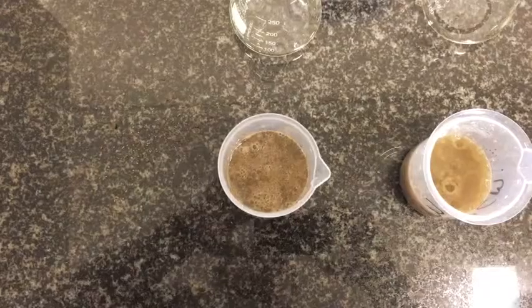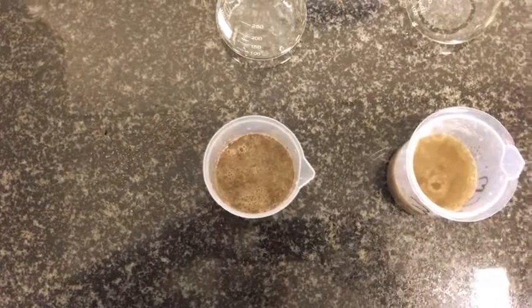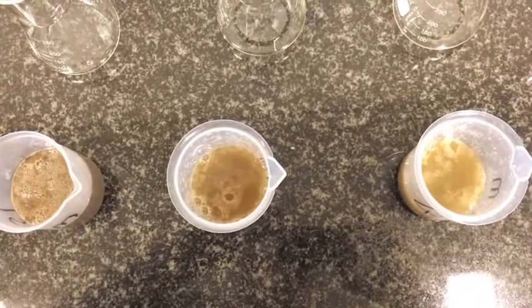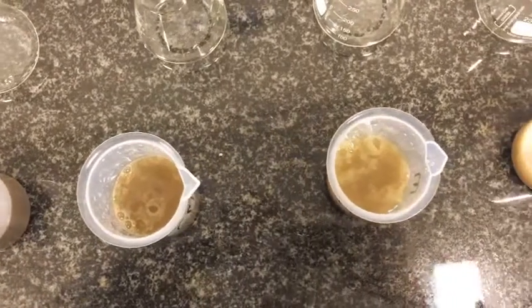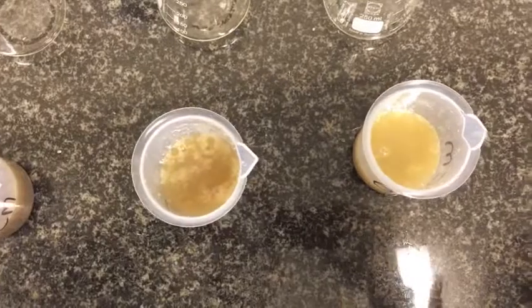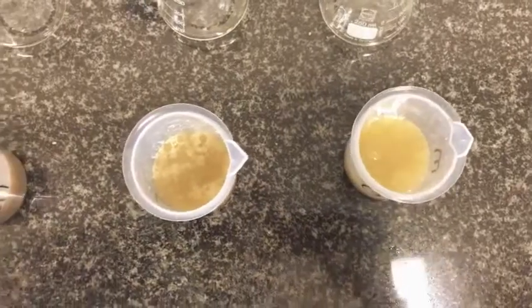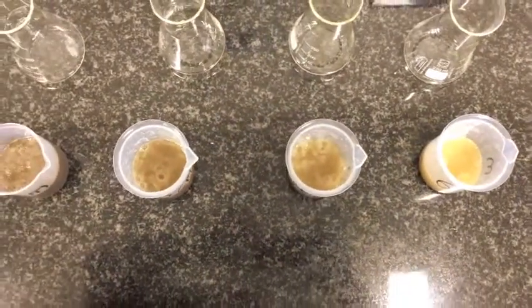The 15 cm soil sample has got more bubbles that have formed, which is expected because that sample was taken at a shallower depth which is filled with more organic matter. The depths that follow, which are the 30 cm, 45 cm, and 60 cm depth, do not have as many bubbles formed compared to the 15 cm. This tells us that those samples have got lesser carbon than the 15 cm.